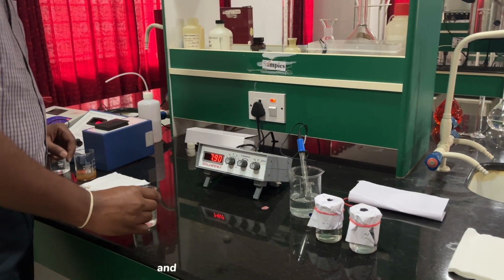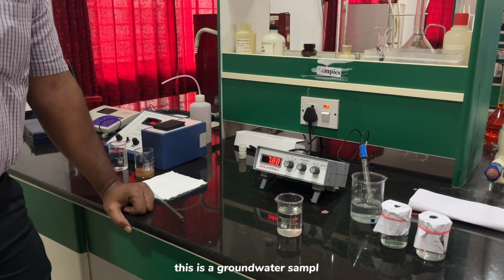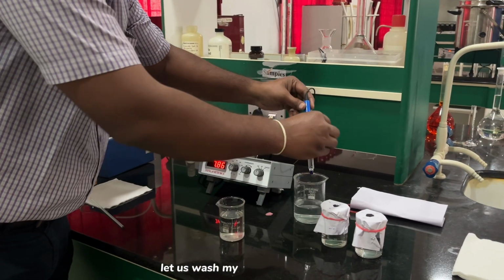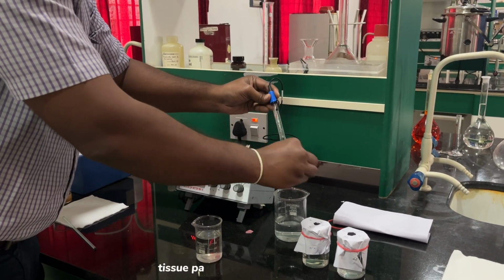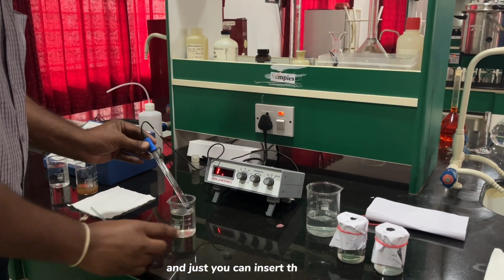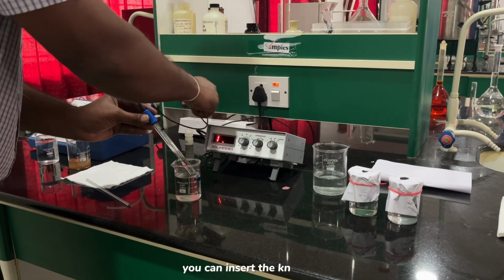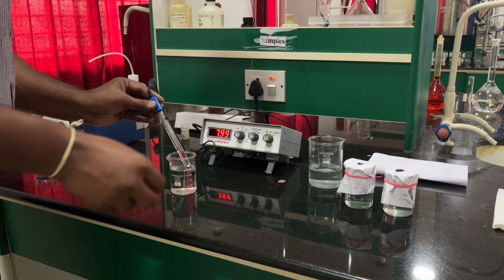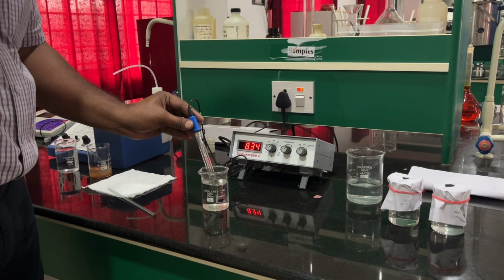Now we have a sample for that. This is a groundwater sample. Let us wash the electrode knob with tissue paper and distilled water, and insert the knob in the water so that the pH gets measured.